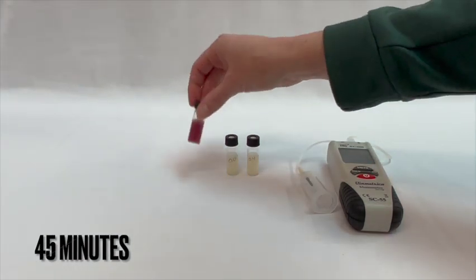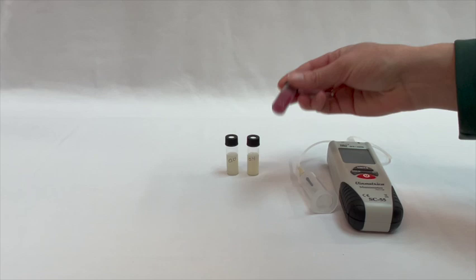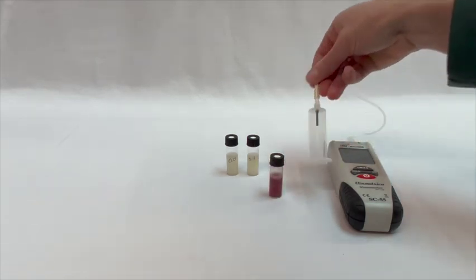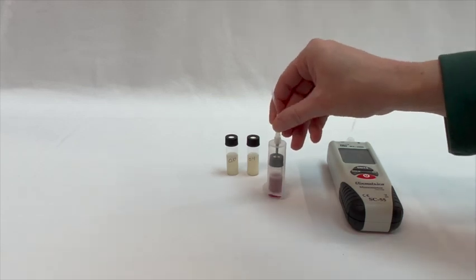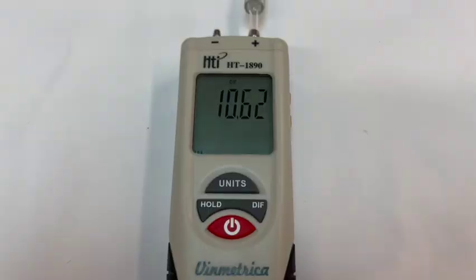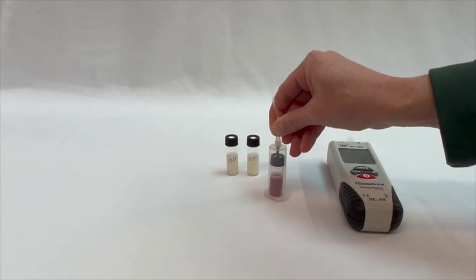Immediately following the 45 minute incubation period, shake the vials one last time for about 5 seconds, then immediately take the pressure reading by holding the vial insertion assembly from the top and press down so that the needle inserts into the vial's septum. Record the highest value that appears on the screen. This process should take about 5 seconds.